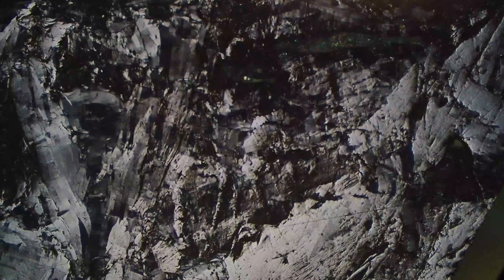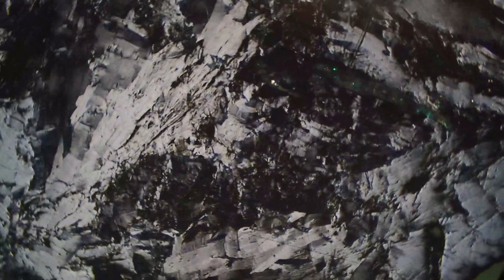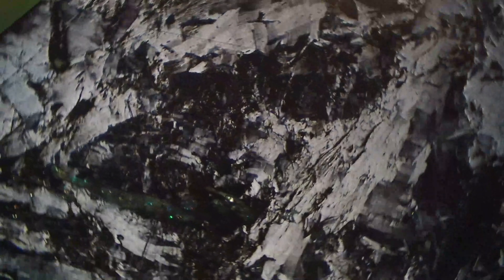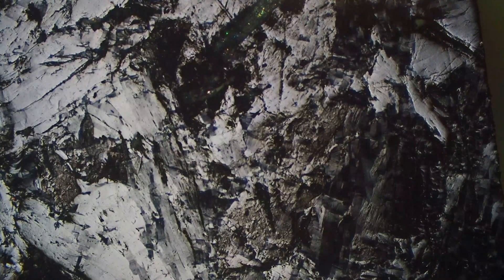Now we're going to cross the polars and again we see the strong anisotropy as we rotate the stage in cross polarized light. And then this one, maybe a bit more than the last one, you get a bit of that pinky color I mentioned, as it goes kind of pinkish-white through extinction.